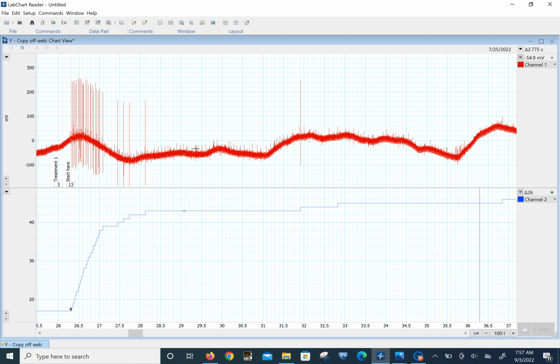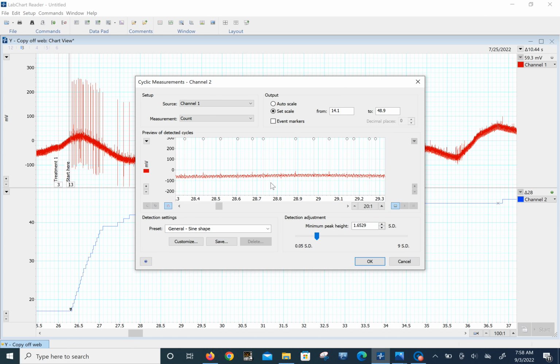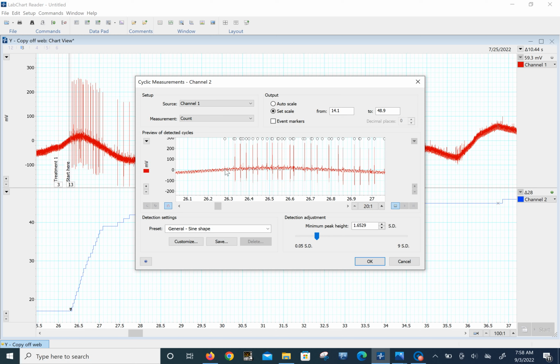Let's say we want to count these smaller ones. Let's click here just to make it show up first. So 28 for the large ones. We can get rid of that. Now we can change the standard deviation lower. And we see that the smaller ones are beginning to come in. See those little circles up there? There we go. If you want to blow it up a little bit to take a look, you can see, yes, we got all these little small ones that are just above that 60 cycle noise that's down there. And we get all the big ones too. But wow, it's getting some that are just barely above the noise.